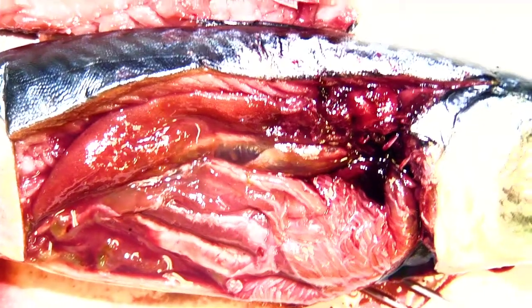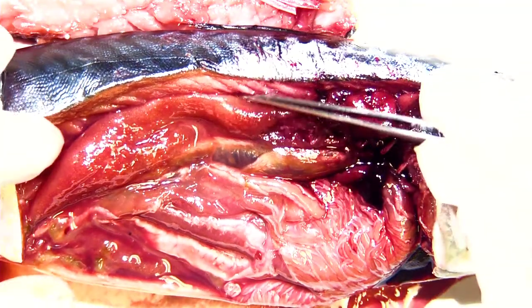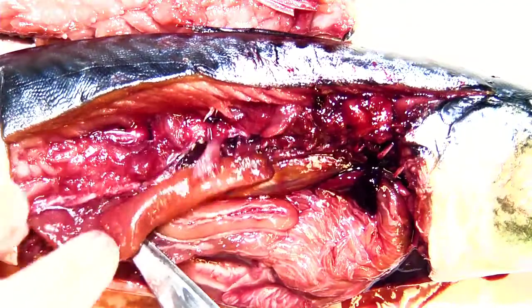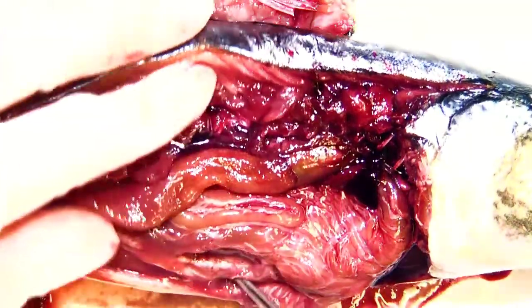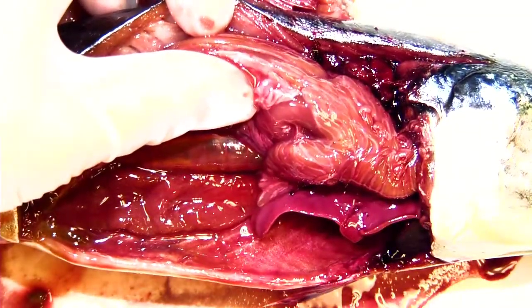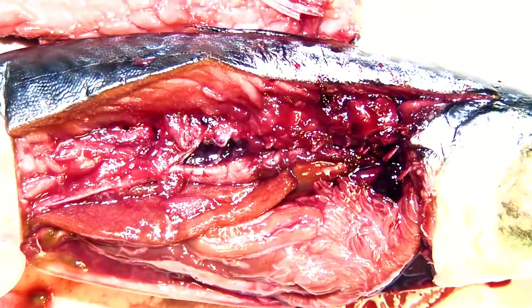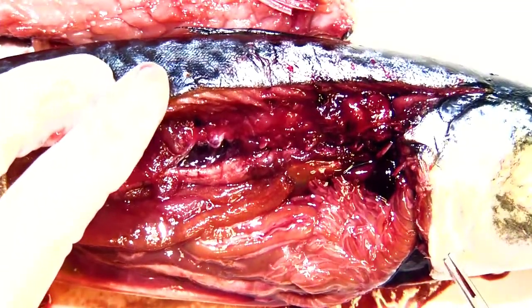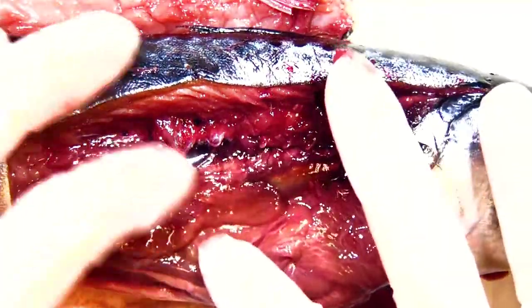This is actually a female fish — we don't always know because these aren't quite full grown yet. But do you see this flap right here? This is a flap of eggs — basically a whole bunch of eggs all attached to each other — and they have one on this side and another flap on the other side. So they have basically two sections of eggs, and they would lay those eggs from that cloaca. The eggs take maybe four or five days to hatch, and when those babies hatch they are basically see-through, tiny little mackerel that will eventually grow into something much larger.